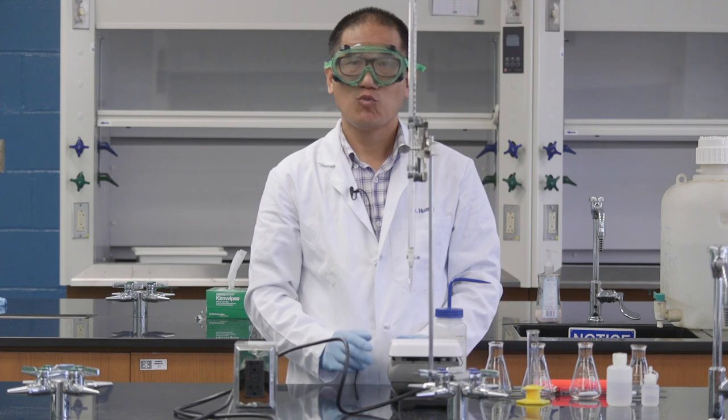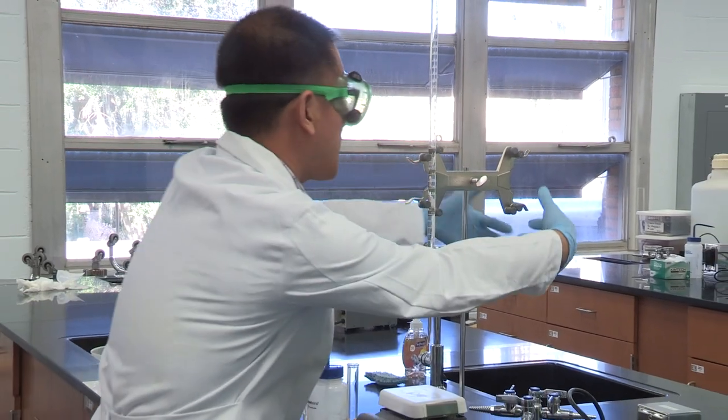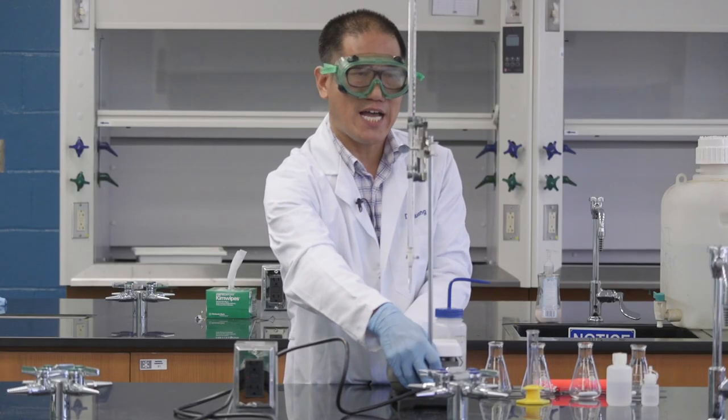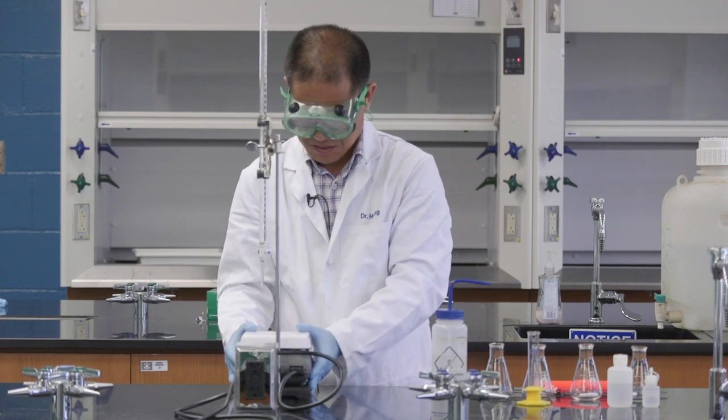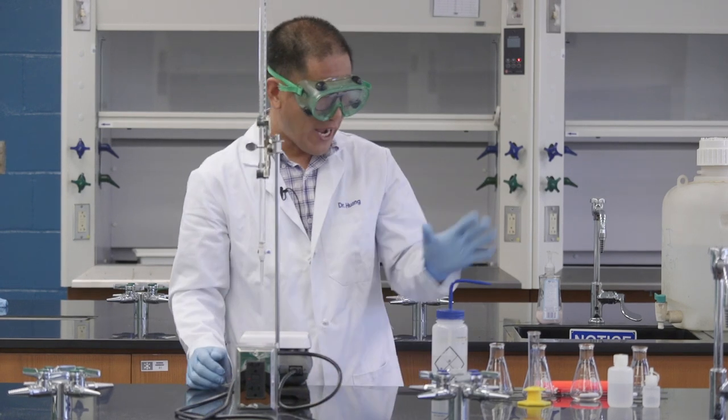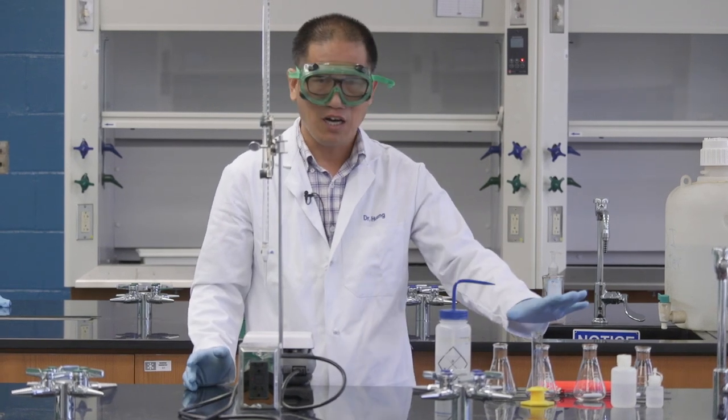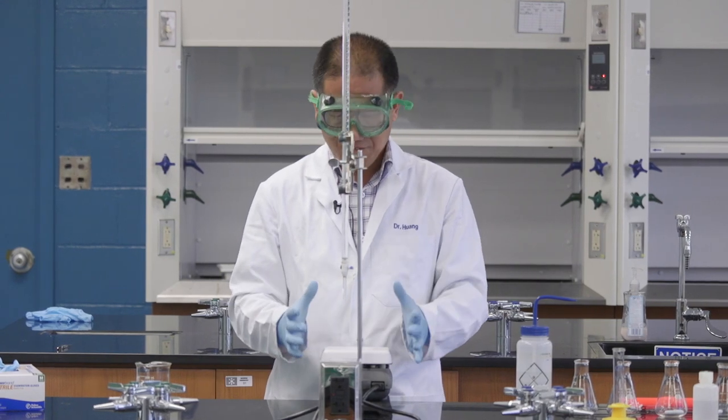When you do an experiment, you want to make yourself comfortable. You do not want to do an experiment to do titration like this. So, let's try to move them around so I will feel most comfortable. And also, I want to stay away from the other part. If something happens, I don't want to knock them down. At this position, I feel most comfortable.